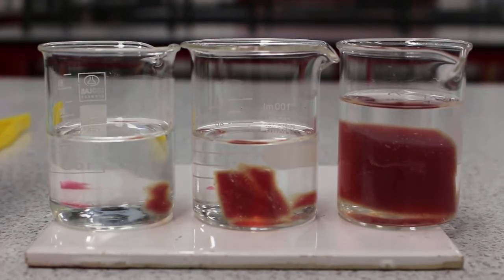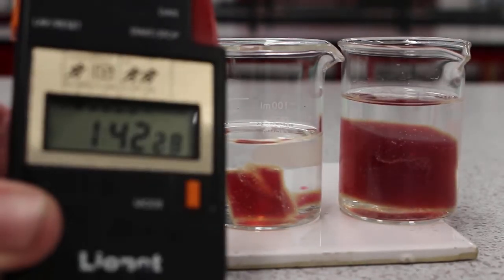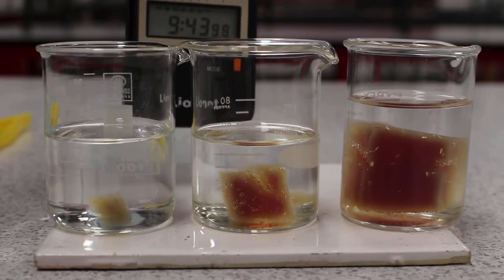This is what they look like after around about two minutes. You can see, certainly with the small one, there's the clear edge around it where the acid has diffused.